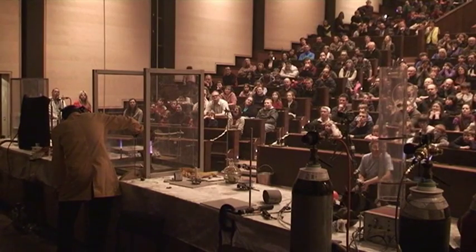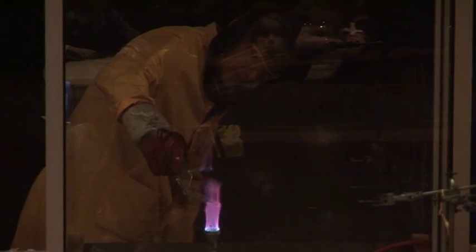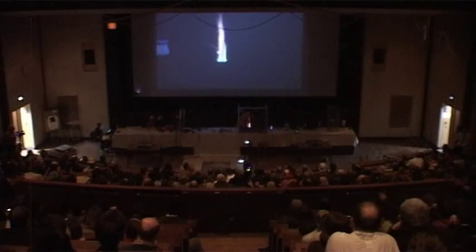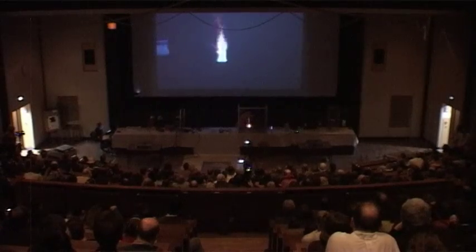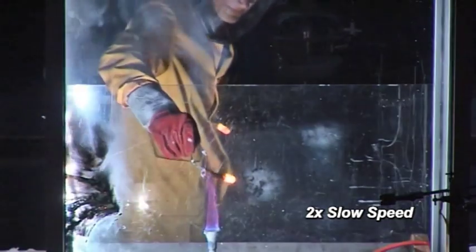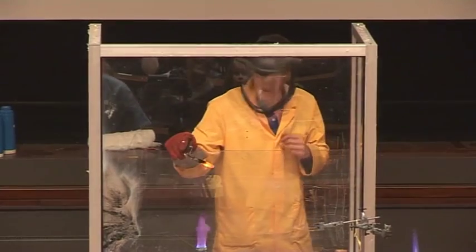Warming it up. It's beginning to go... There we are — it certainly did react. In fact, half of it's all over my safety screen.